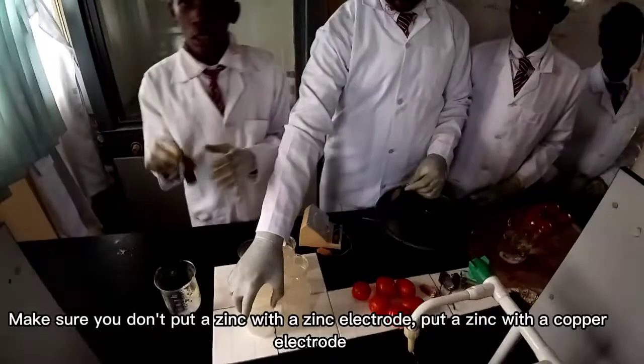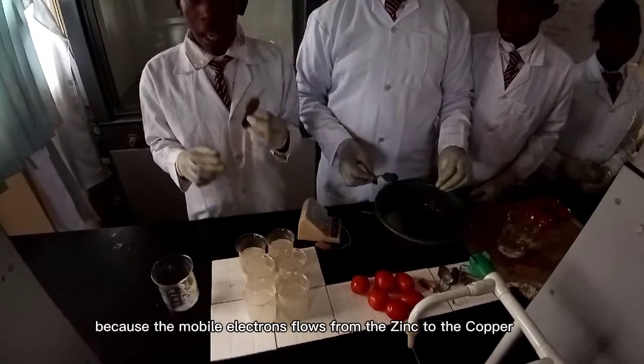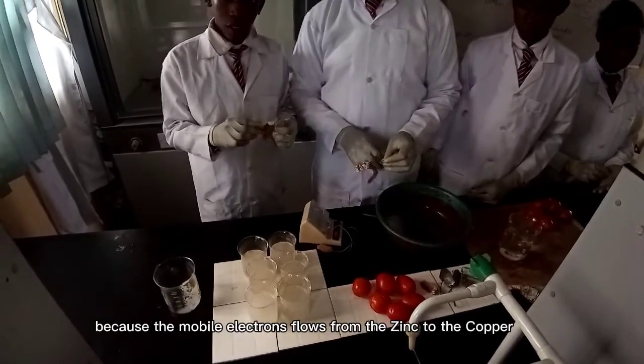Make sure you don't put a zinc with a zinc. Make sure you put a zinc with a copper, because electron flows from the zinc to the copper.